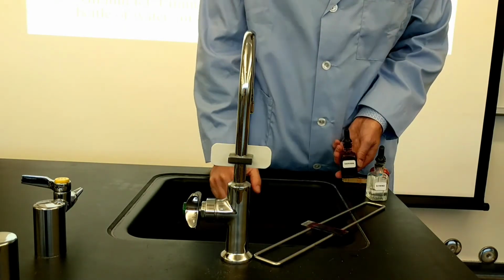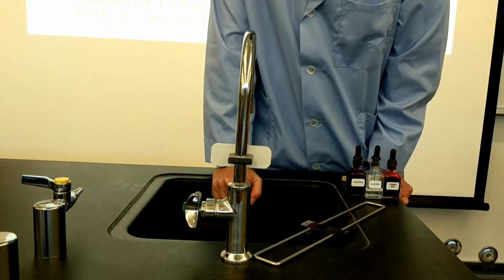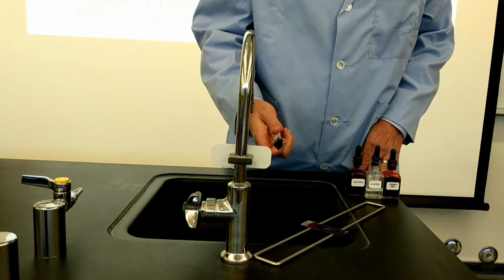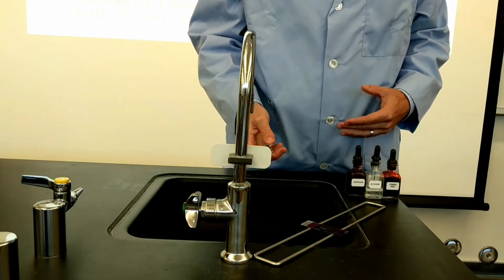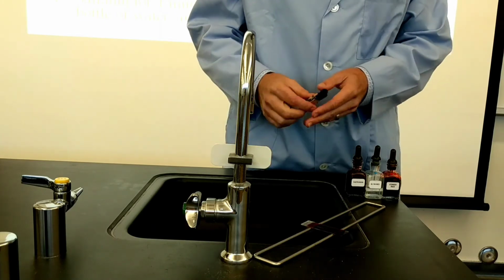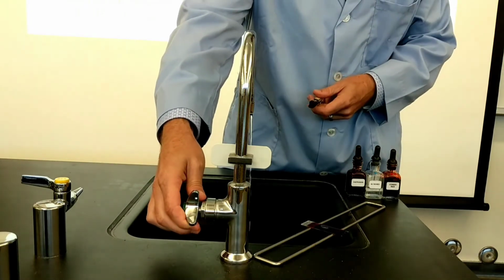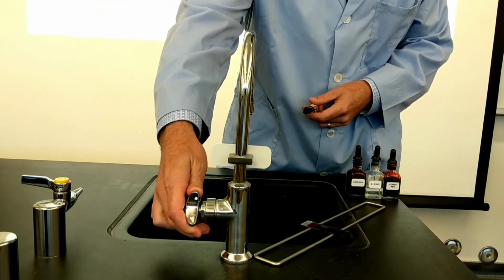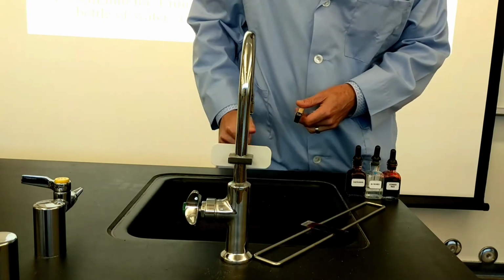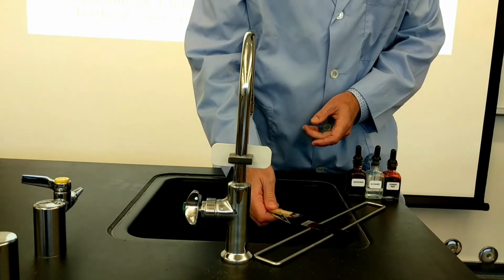I'll explain in detail what these chemicals accomplished in just a moment, after the close-up view. While we're waiting for that 1 minute, you have to have your slide clip ready to go. We want to be careful about the timing and not leave these chemicals on for too long. We can get ready to rinse. We're going to do a light rinse, and because this is really delicate, it's going to be just the softest stream of water that you can provide so that you can get the safranin off of there, and then you can blot dry your slide.